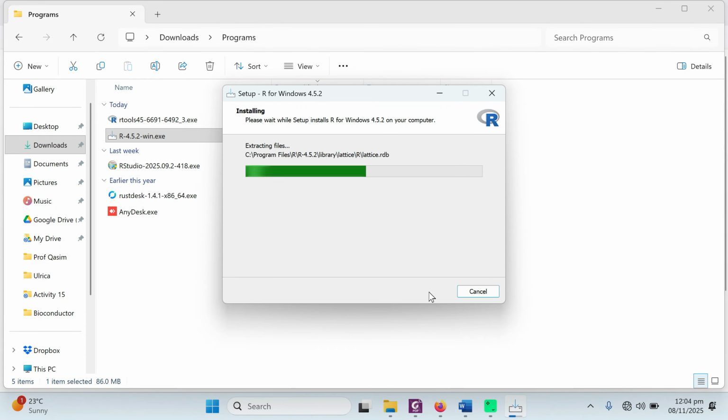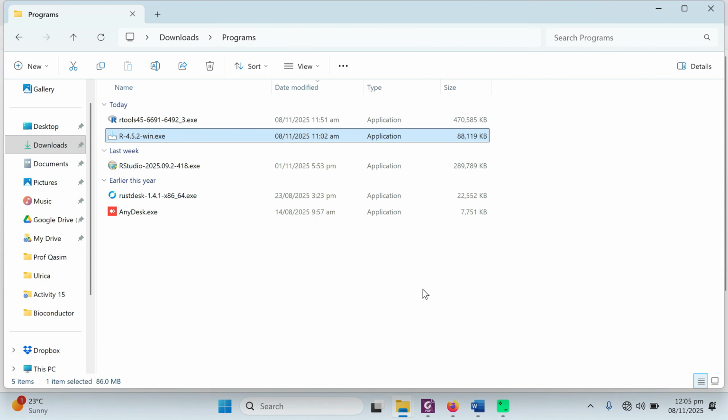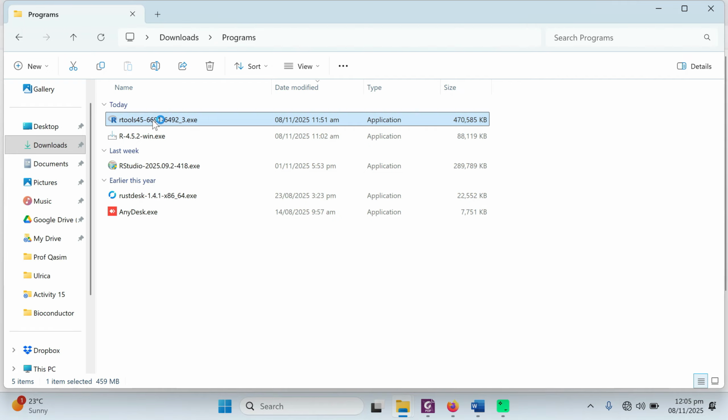Once R is installed, you can install RTools. After installing RTools, you can install RStudio. The R installation has been completed. Click on the finish button and it's done. After installing it, install RTools. Double click on RTools.